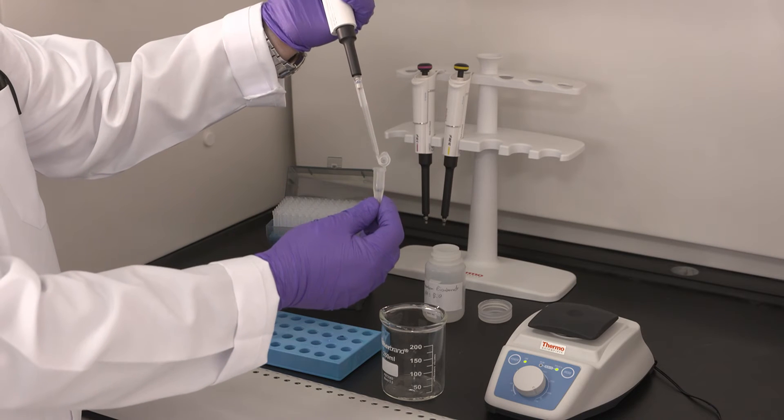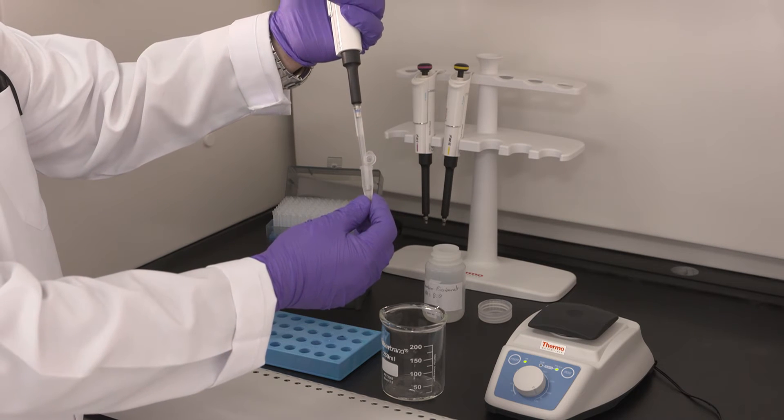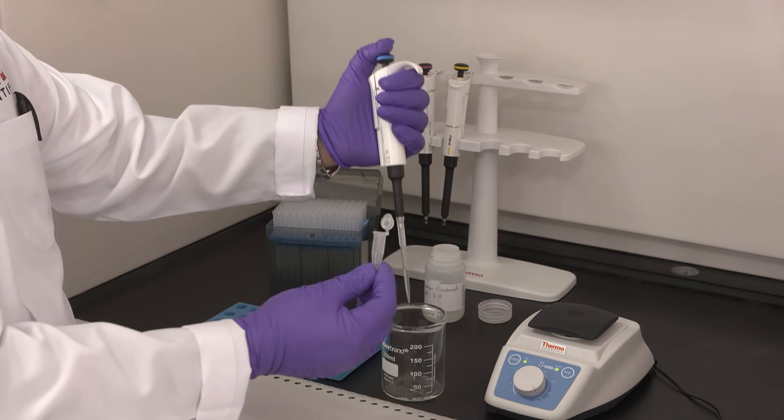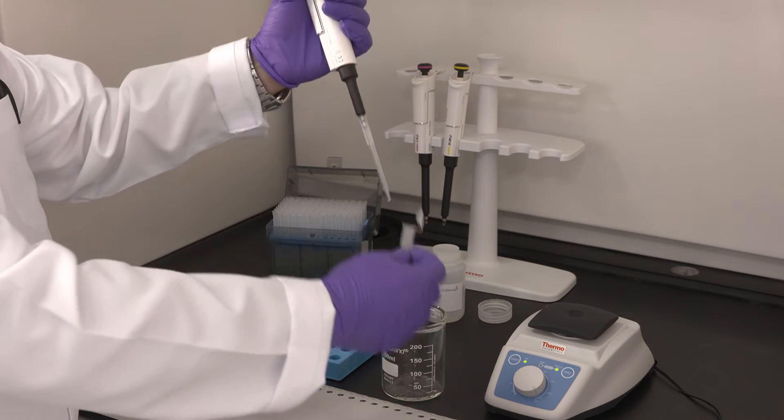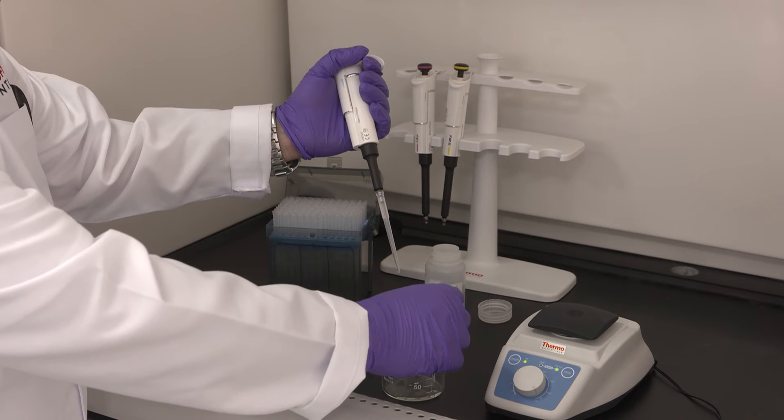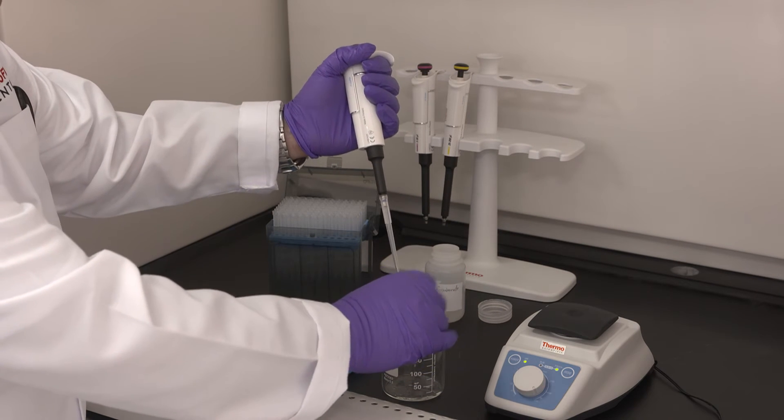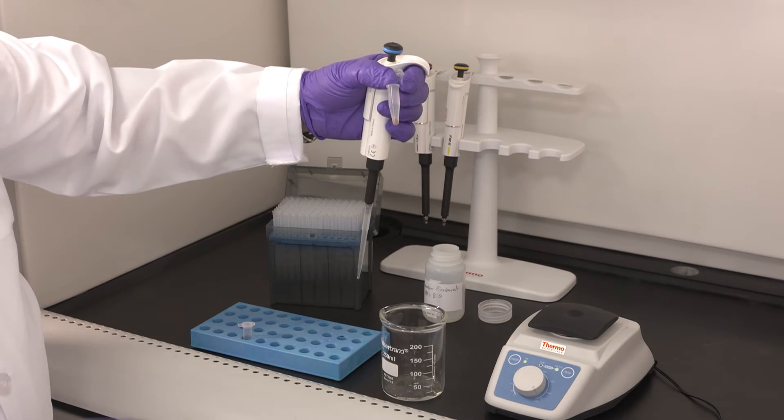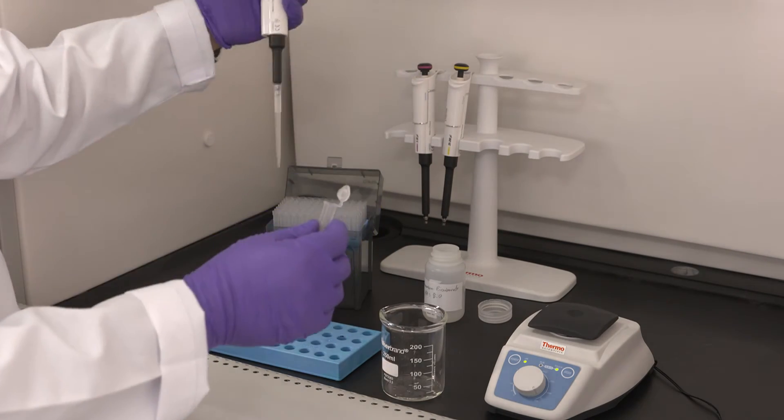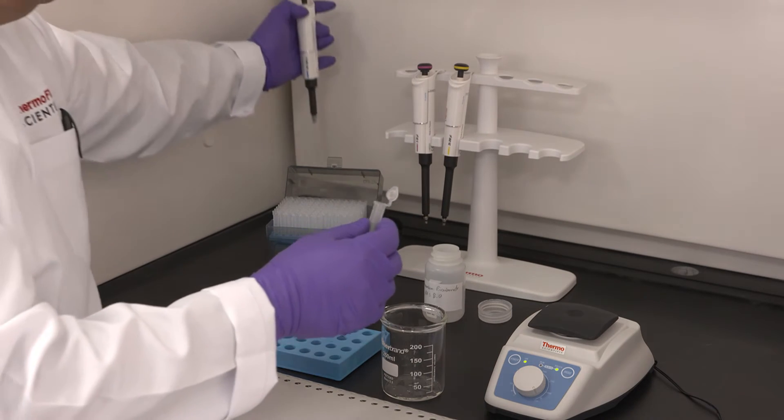We will remove them with pipettes. You could also remove the excess by evaporation using a nitrogen evaporator. It's not necessary but if you would like to remove the excess, you can use a nitrogen evaporator as well.